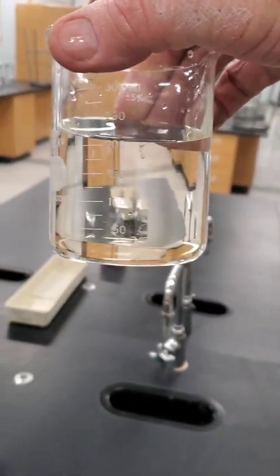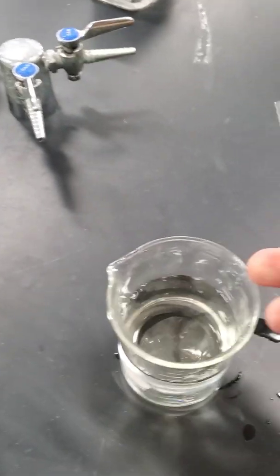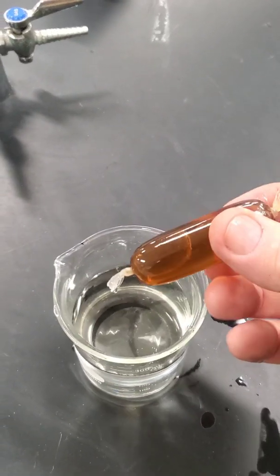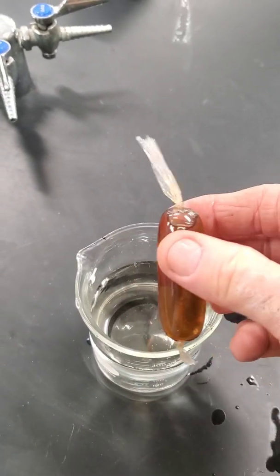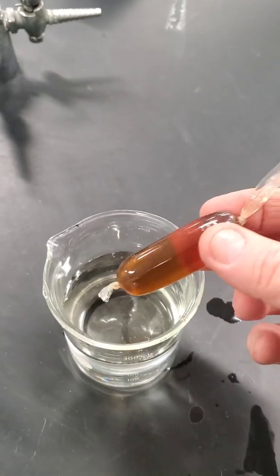Notice also that the distilled water is still clear. So what's happening to our little tube and why?